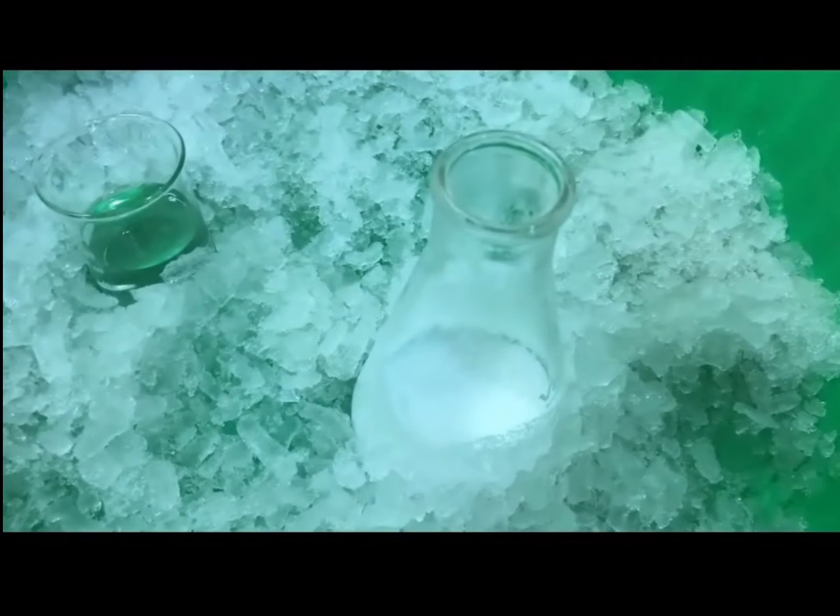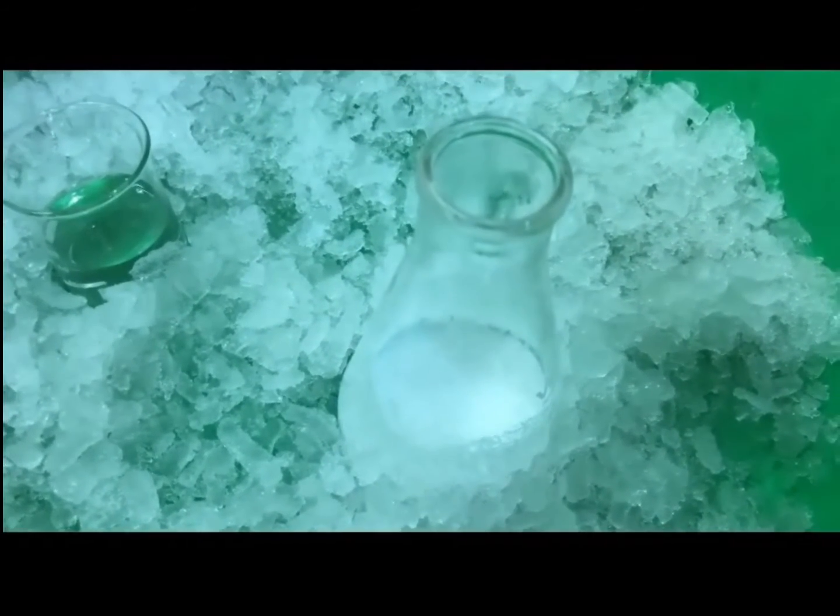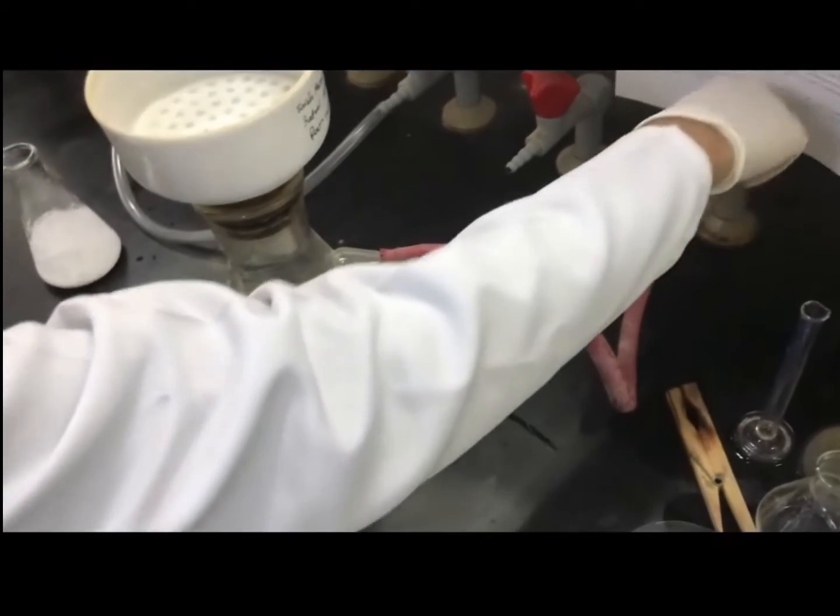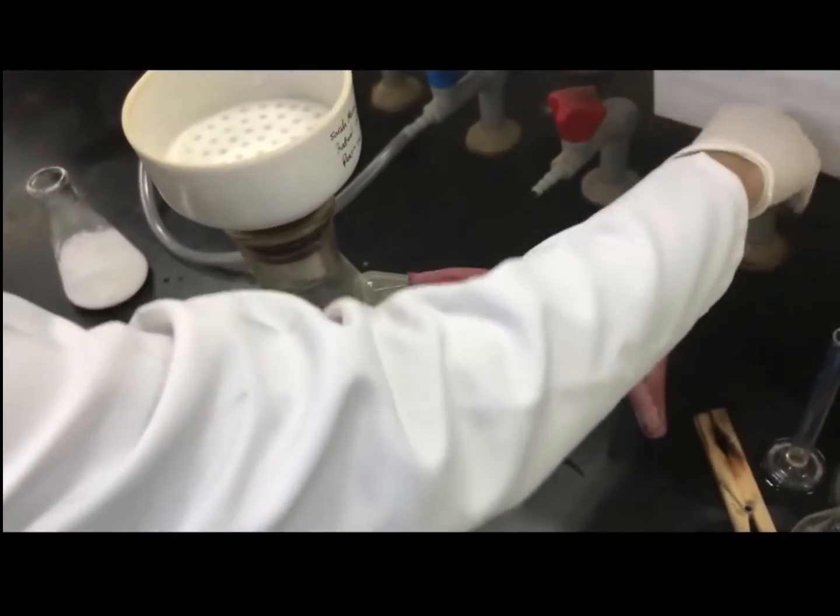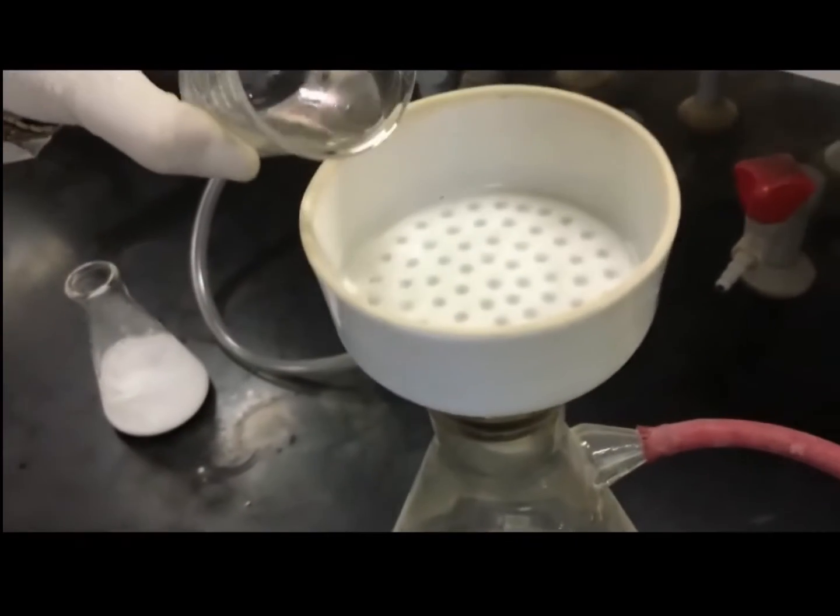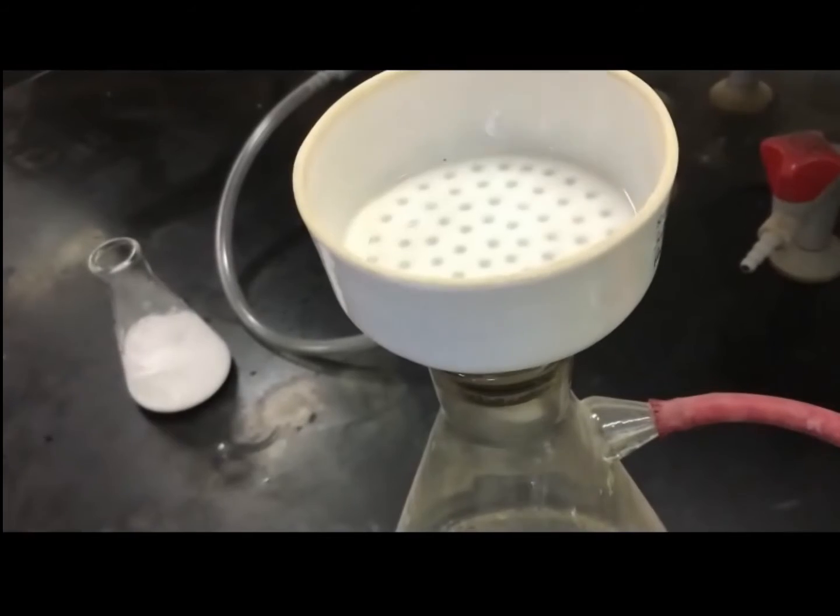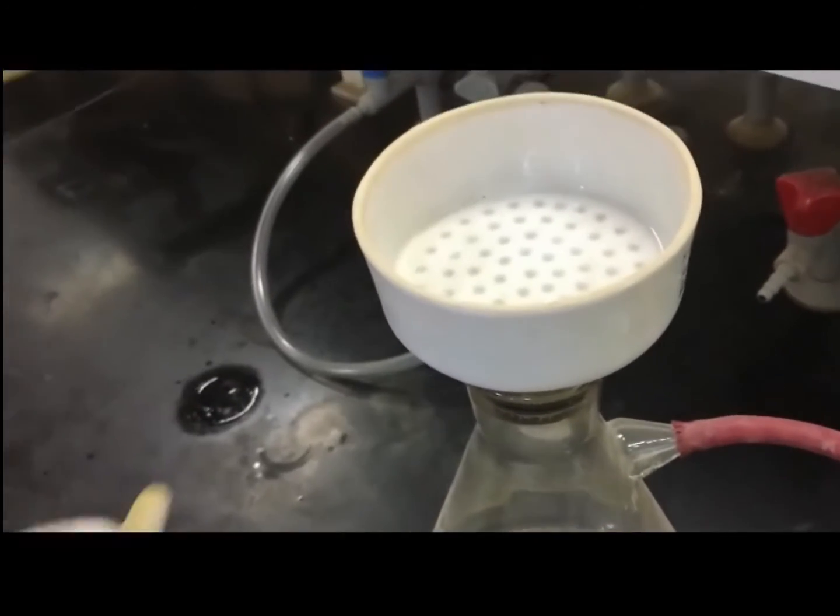Now we will collect the crystals using suction filtration. Open the vacuum valve and rinse the filter paper using distilled water. Now add your product.